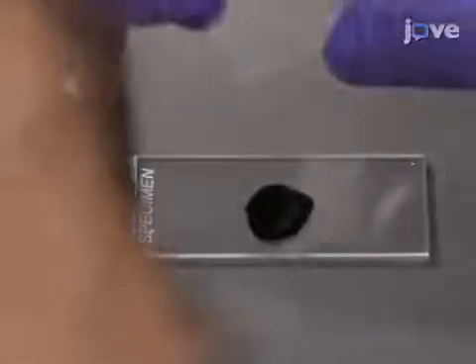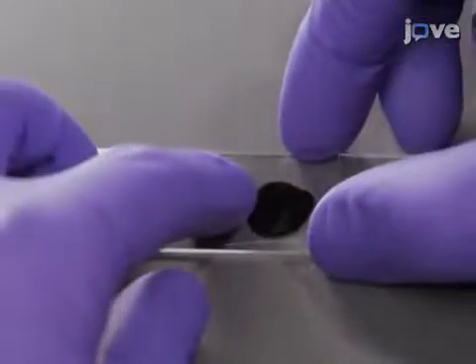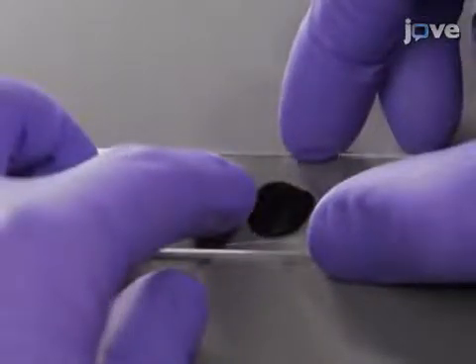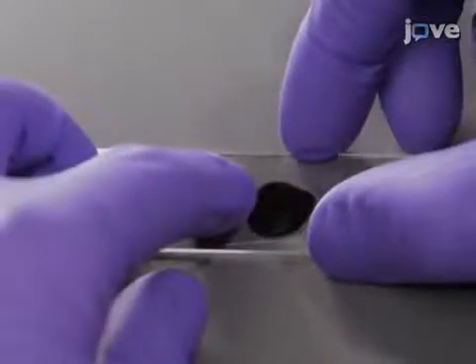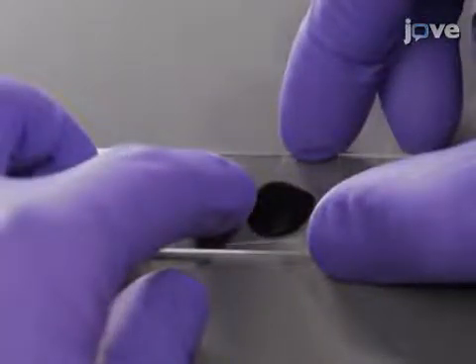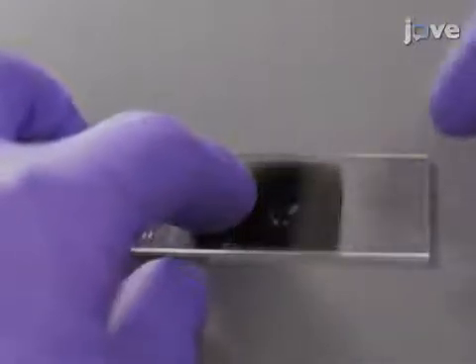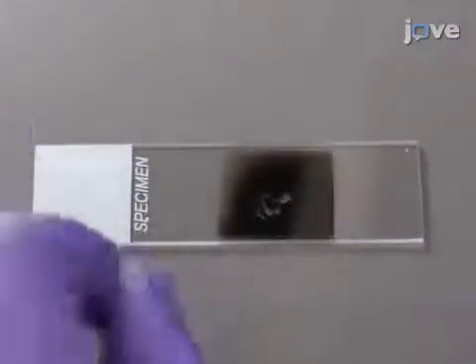Place a cover slip over the sample by holding down the left edge of the cover slip against the surface of the slide, then gently and evenly lower the opposite side of the cover slip over the sample.